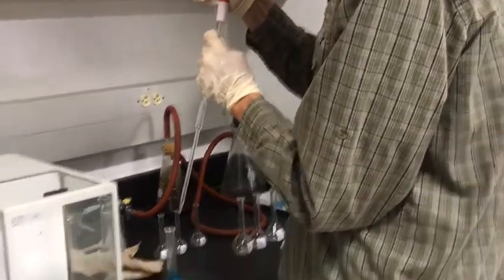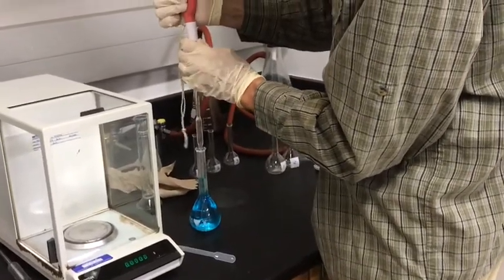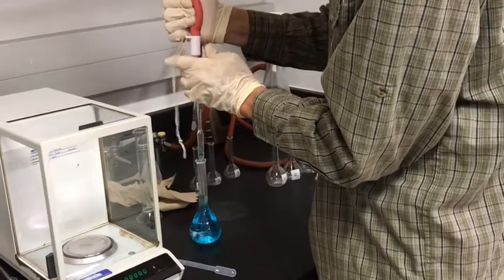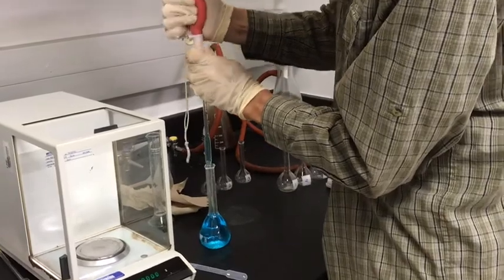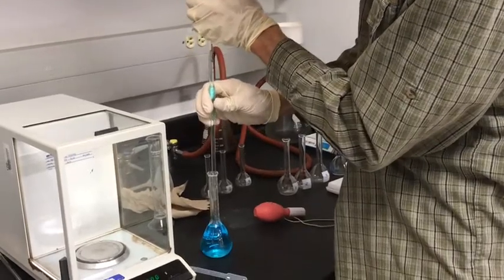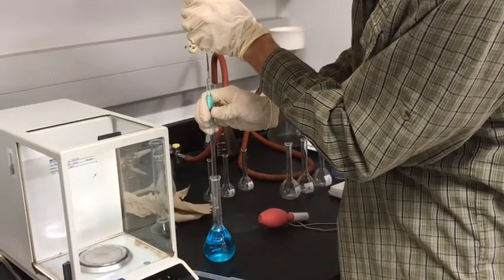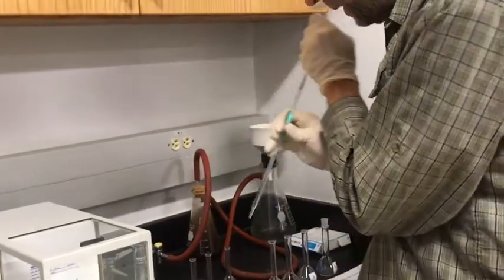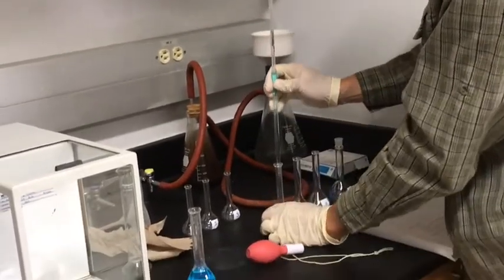So what we'll do is we'll put this into the solution, and then you release the pipette bulb to create a vacuum, and that will bring the solution up part way. If you don't get it all the way up there on the first try, you can just squeeze the bulb and do that again. Now, see, I've got my thumb on top here to control where this is, and I will stop it right there. It stopped at the line. I will put this into flask number 1 and just let it drain in there.